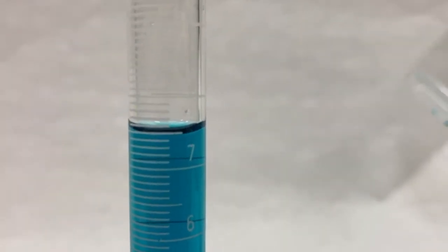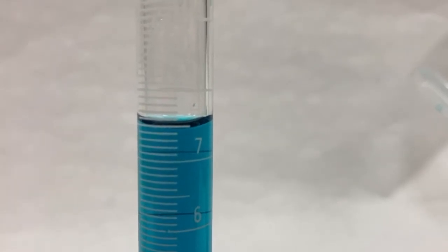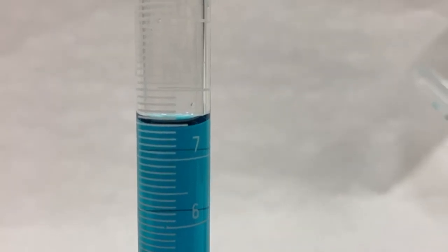the meniscus. Remember, we read the meniscus, the bottom of that curve. So not the top, but the very bottom, kind of where my fingernail is, right here. What would you estimate that to be? And it should be to the hundredths place. So it should be 7 point blank blank milliliters, okay? So make an estimate.